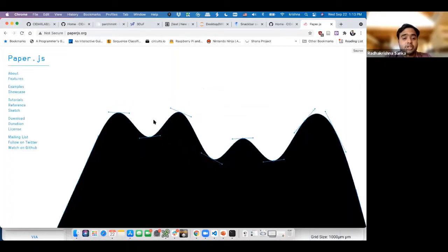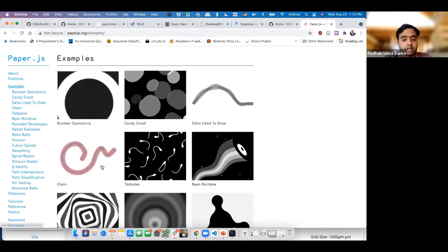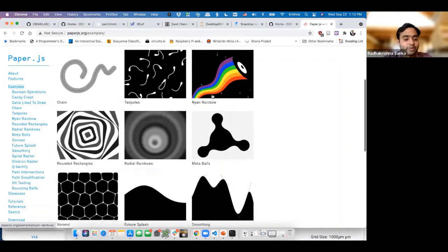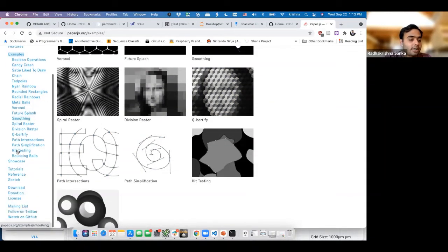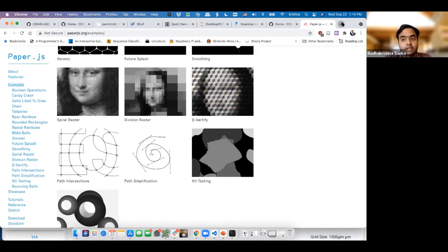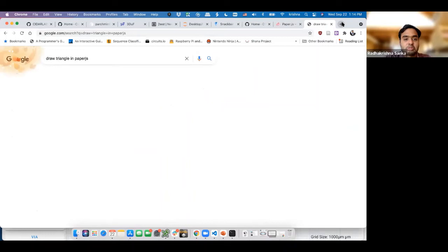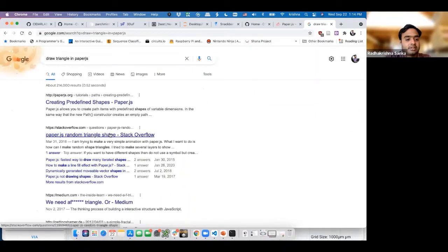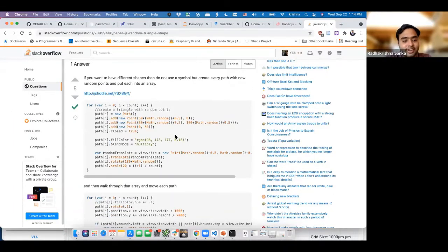Paper.js is a pretty mature drawing library, and it has a ton of references and examples for how to draw all kinds of crazy drawings. So you want to draw a chain, this or that, or a rainbow. Hopefully you're not making rainbows inside 3DUF, but the point is it has ways to do all of that. Now, let's say we wanted to draw a triangle. There's an easy way to do it and a harder way to do it. I'm going to Google draw triangle in paper.js. And there you go. Somebody already has an example on how to draw a triangle.